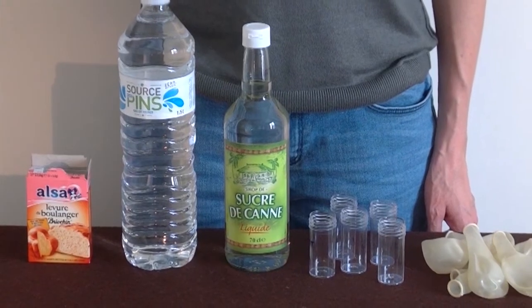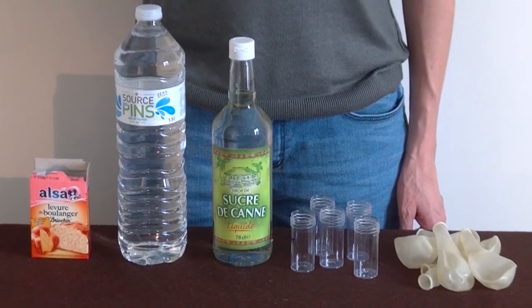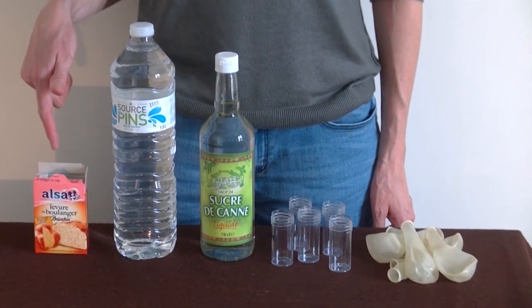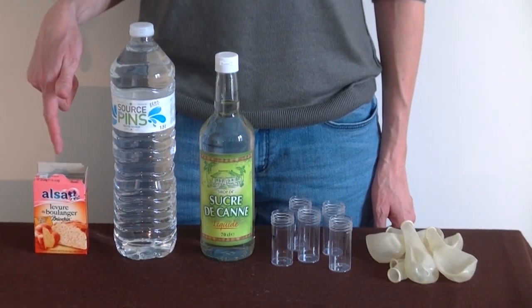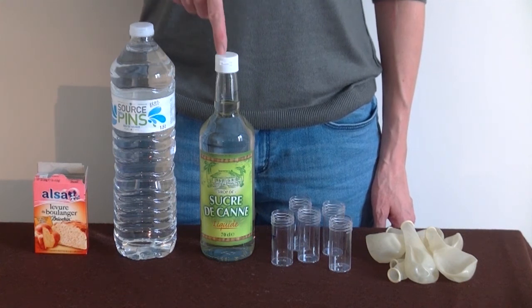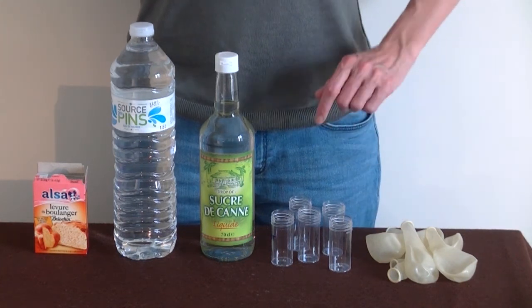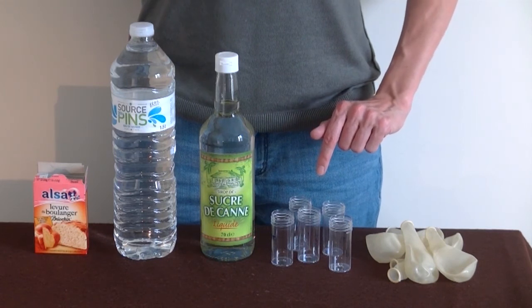For your experimental approach, please gather the following material: fresh or dehydrated baker's yeast, mineral water, cane syrup containing saccharose, several identical test tubes, and balloons.